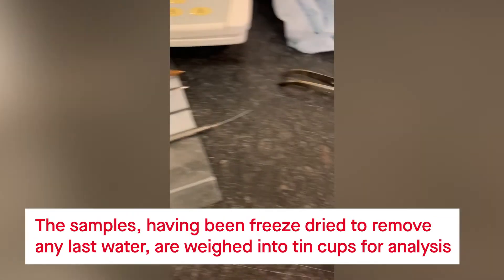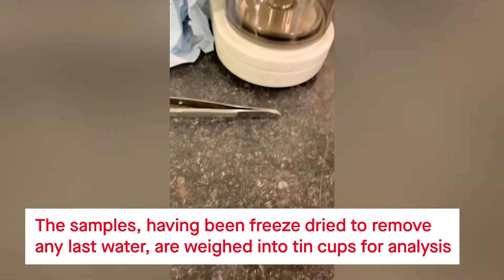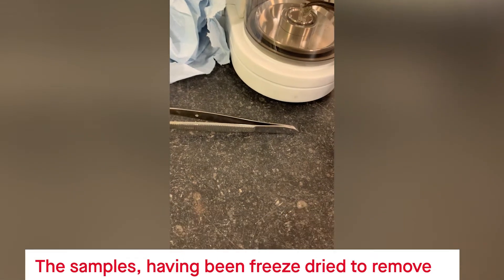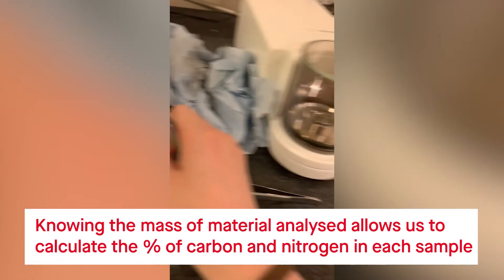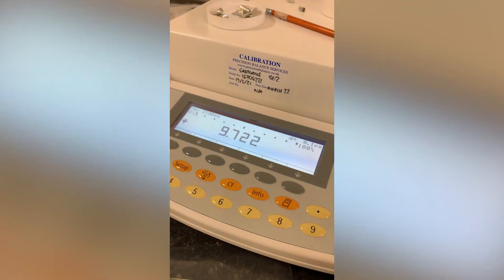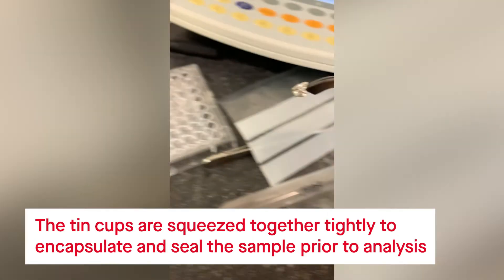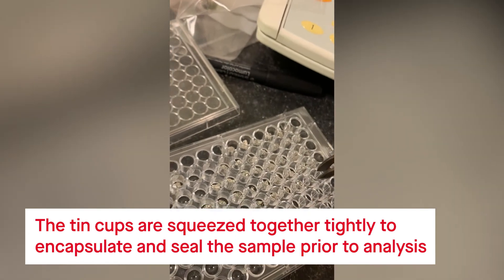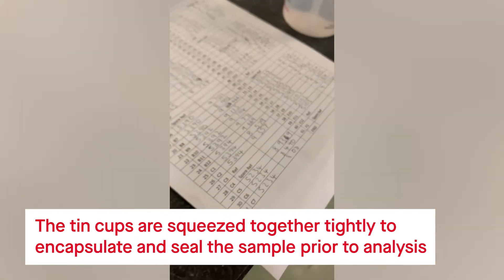Now I have the dried samples and all I need to do is measure them to make sure that we have between 8 and 10 milligrams of each sample and then we're ready to carry on the process. I'll put it onto the scales — it's the right size and the right weight — and then I will record that number on here. Then I scrunch up the foil with the sediment in and put it into the number that correlates with this sheet so that we know what sample it is when it goes to the machine.